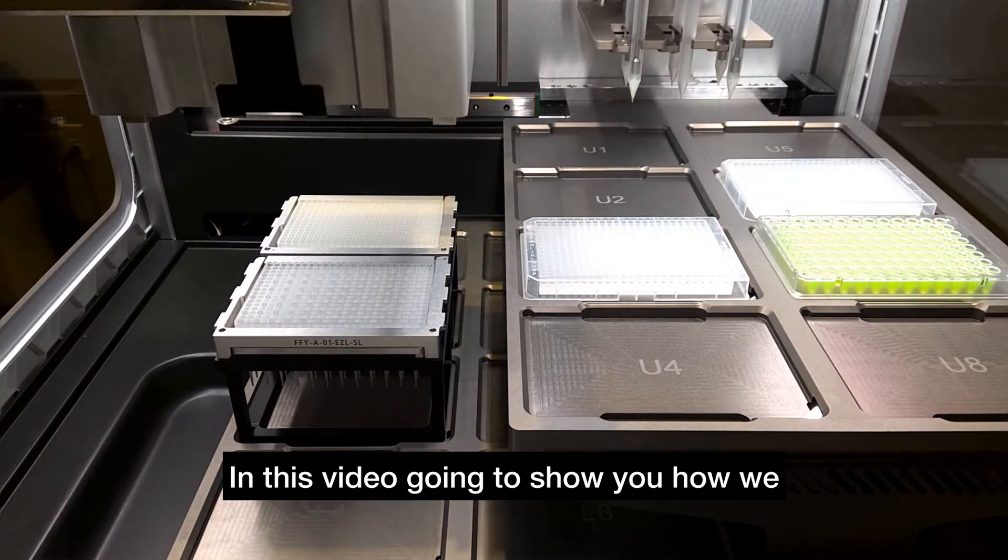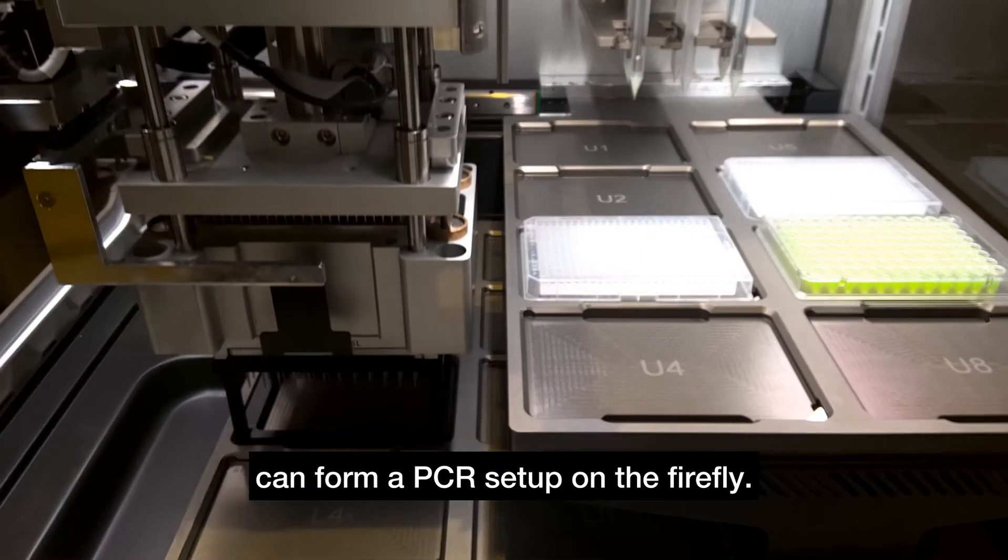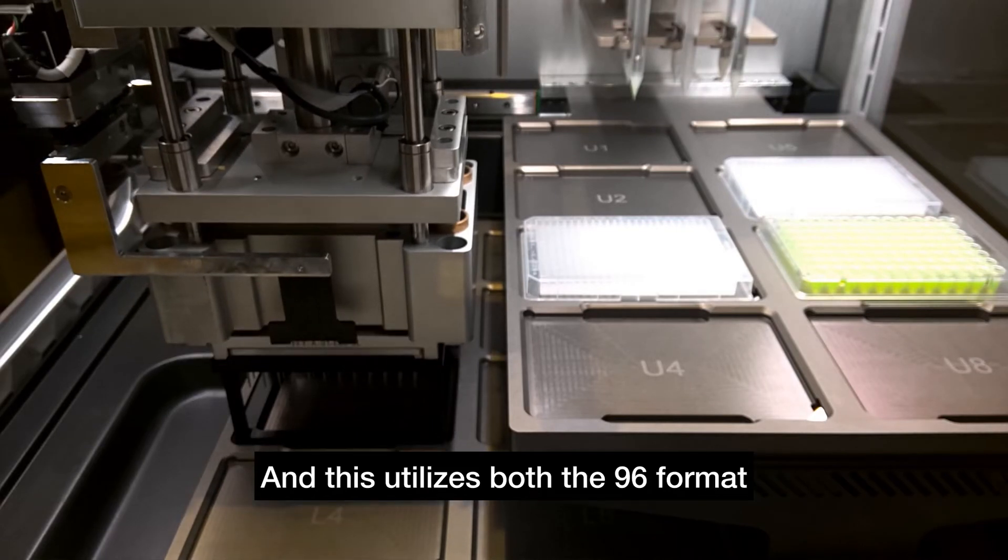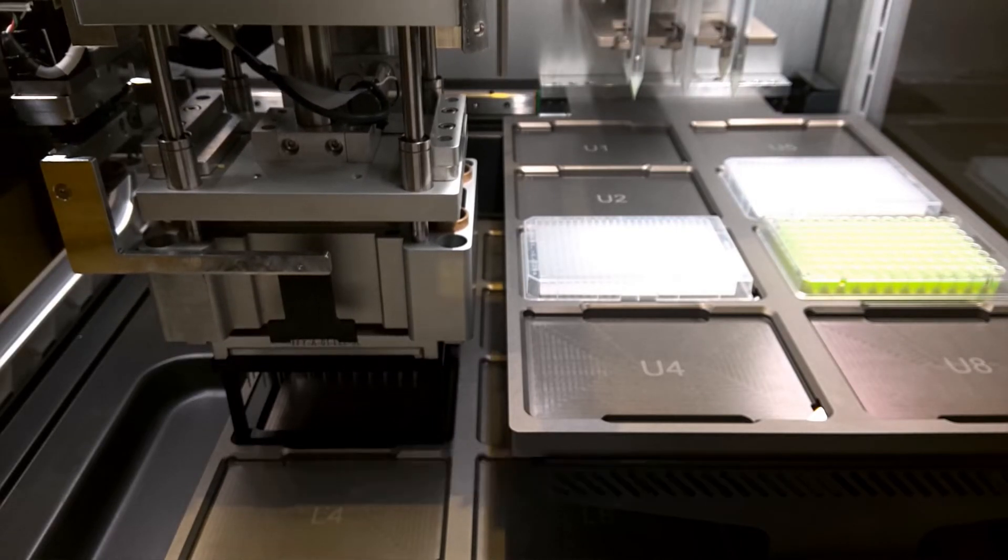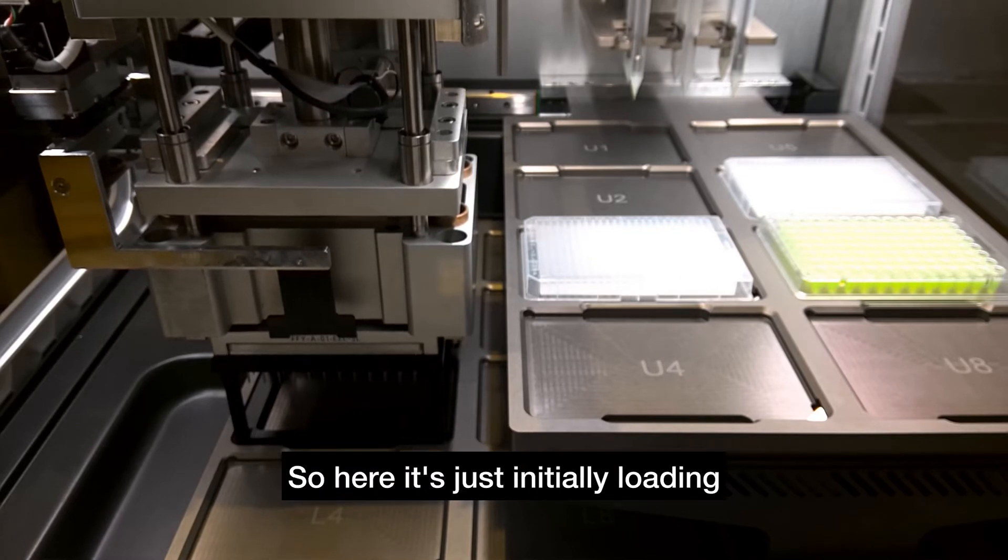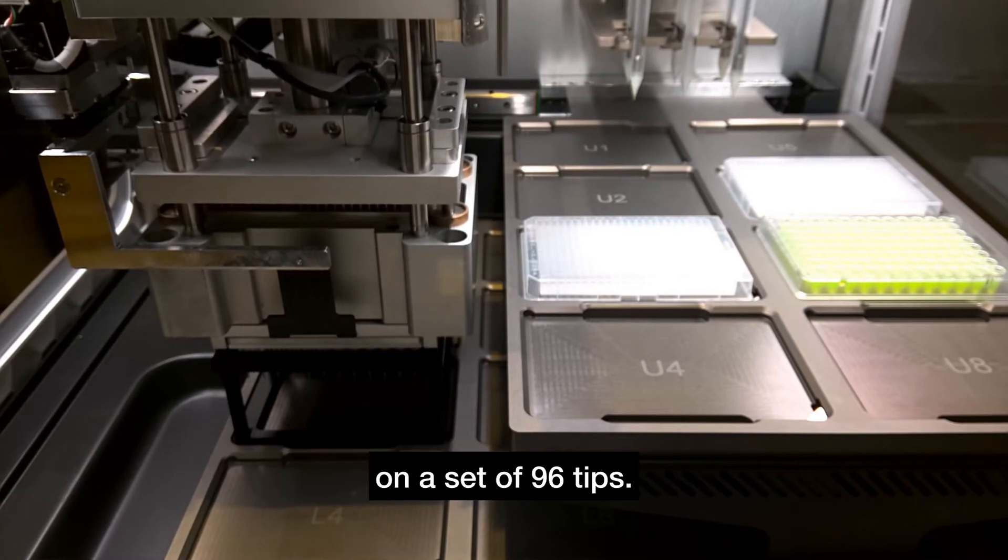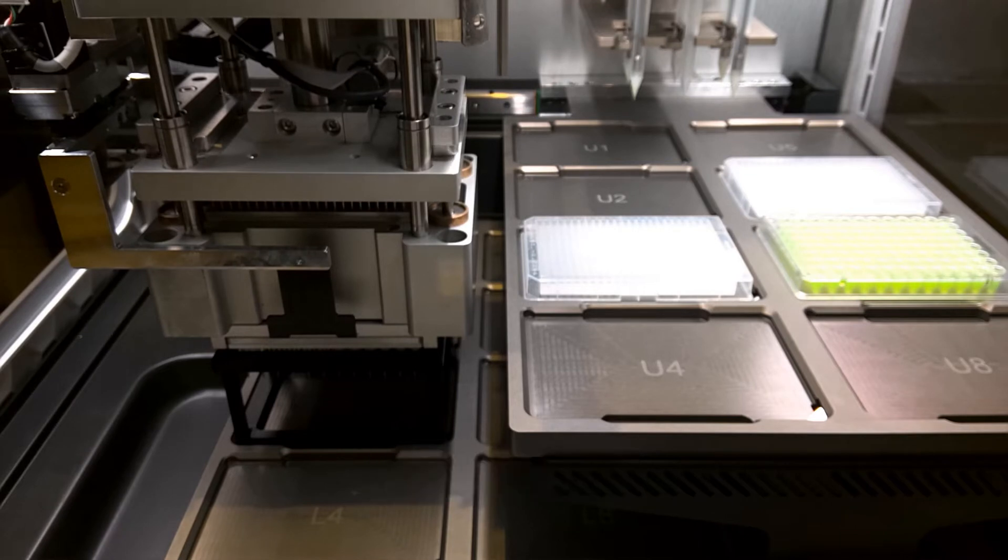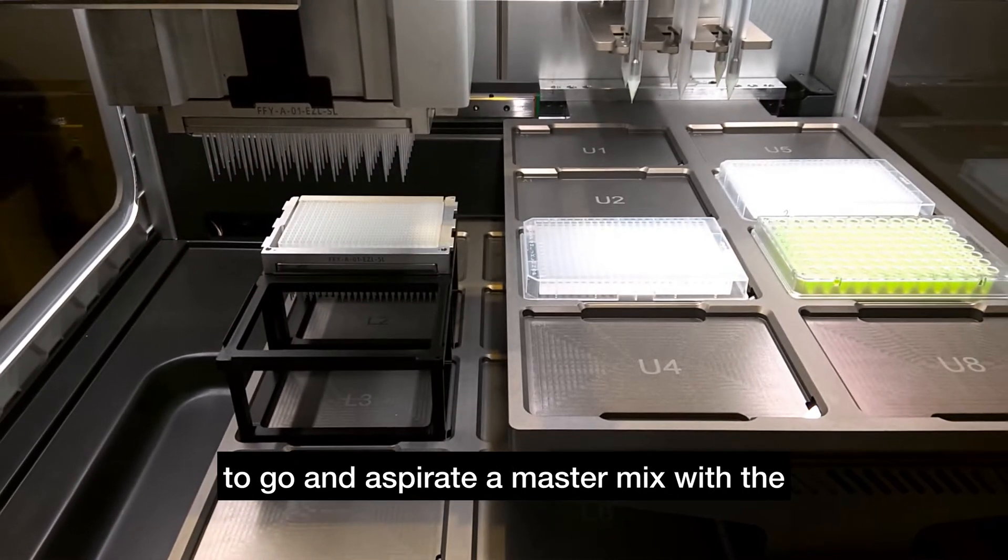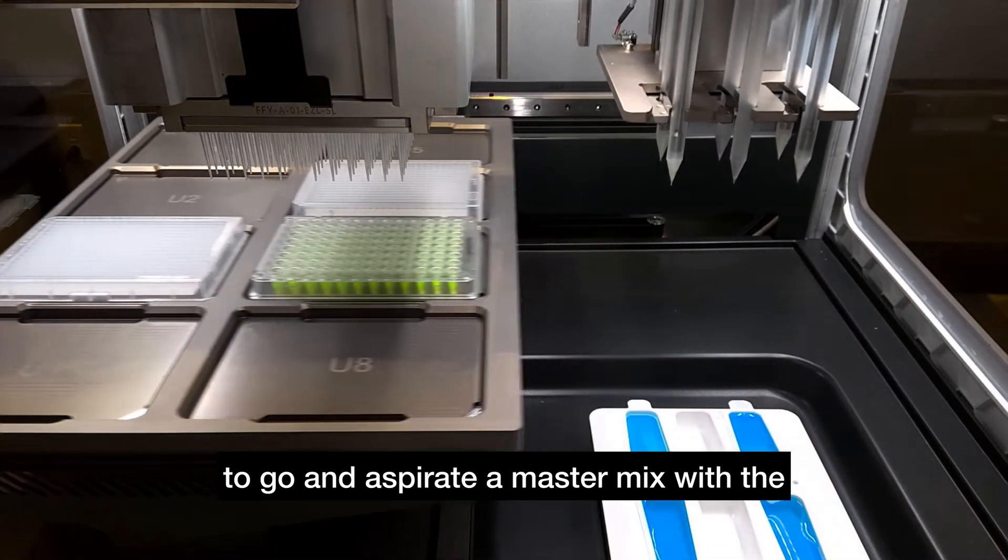In this video I'm going to show you how we can perform a PCR setup on the Firefly. This utilizes both the 96 format tips and 384 format tips. Here it's initially loading on a set of 96 tips, and once it's done that it's going to aspirate a master mix with the syringes on the non-contact dispense head.